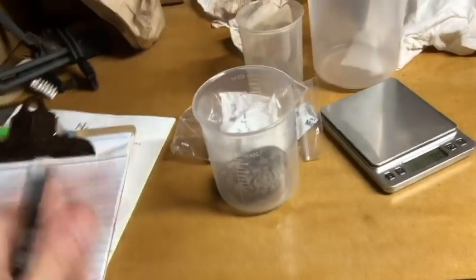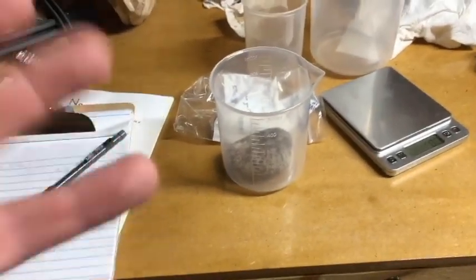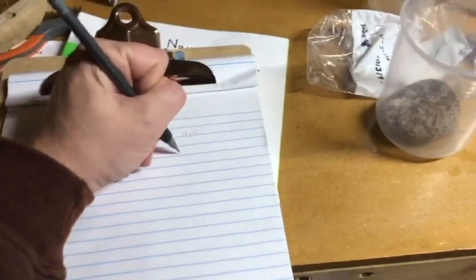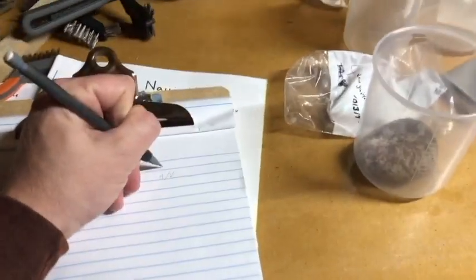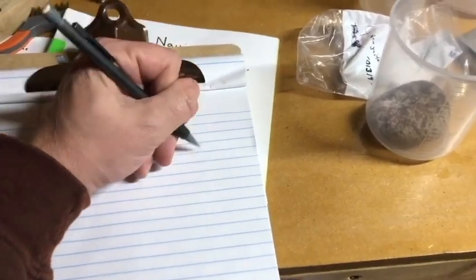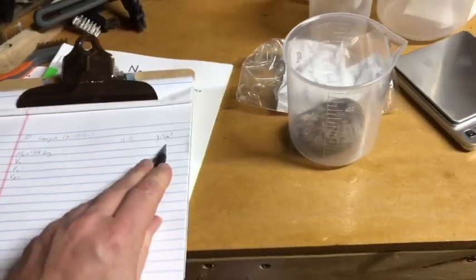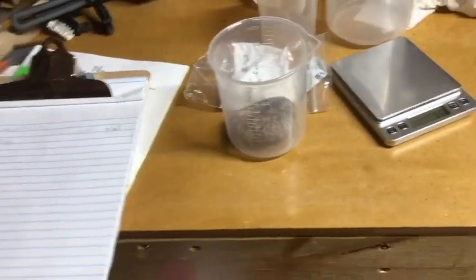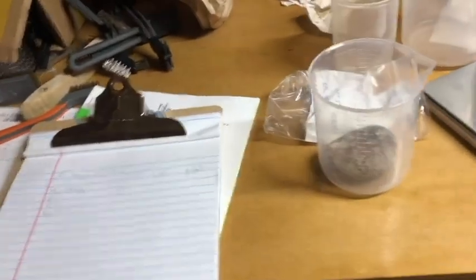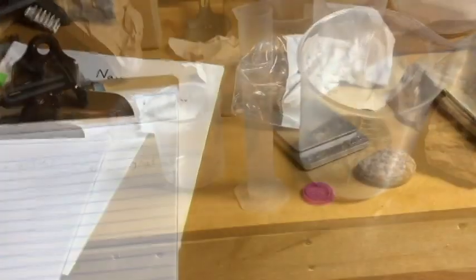This is the beauty of the metric system. 1 milliliter, at STP, is equivalent to 1 cubic centimeter. Because we do density, we do mass in grams, and we do volume, so the unit will be grams per centimeter cubed. 1 cubic centimeter is equal to 1 milliliter. You don't get that in the imperial system, so I can do this in milliliters and just swap the units. So that's the process I'm going to do, and I'll show it to you when it's complete.